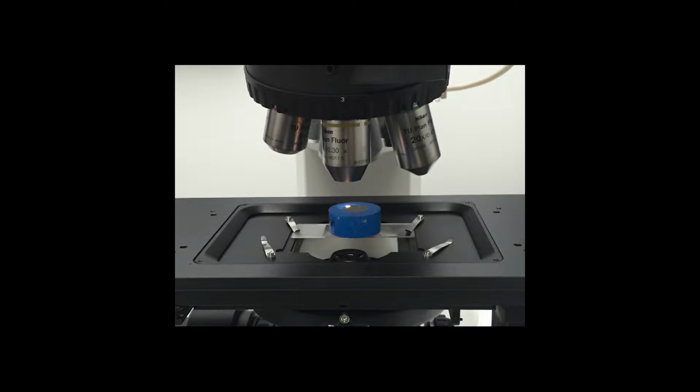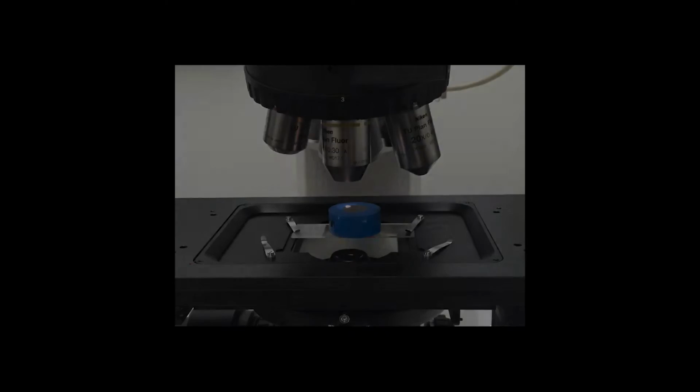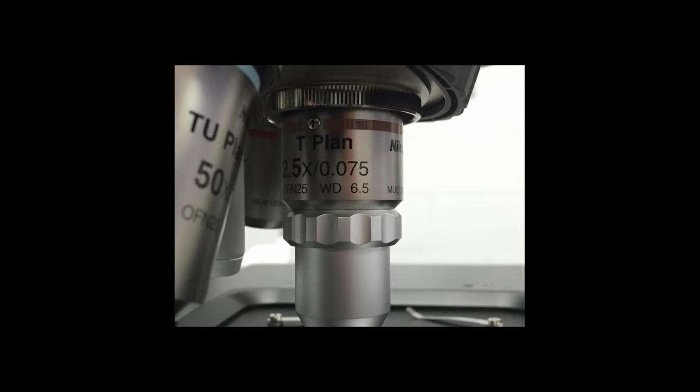To verify if a camera is correctly aligned, select a low-power objective. A 5x objective is usually a good choice since it has a relatively wide field of view, which will be helpful for this maneuver. You could, of course, choose a lens of even lower power, but the chances of having pincushion distortion would increase, making it harder to see if the camera is properly aligned.